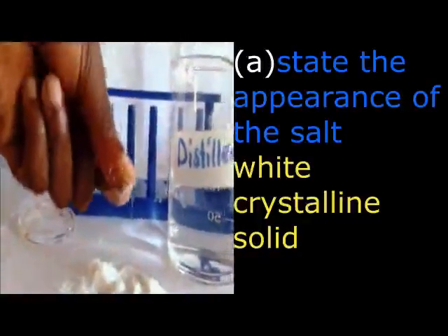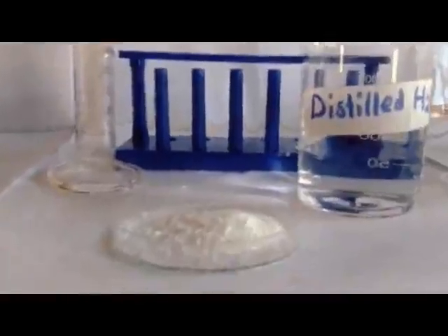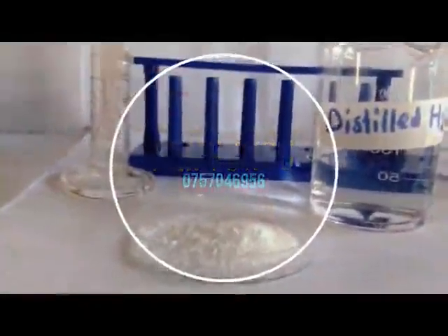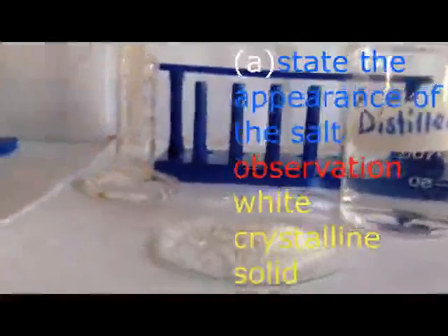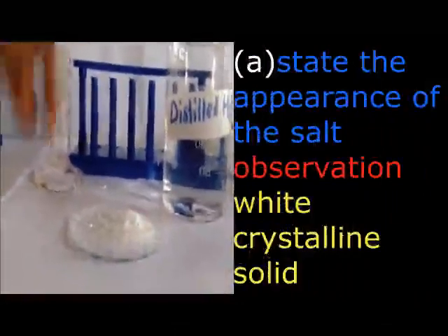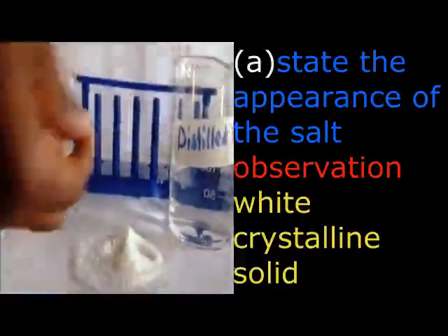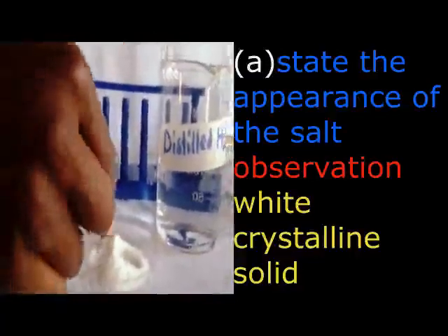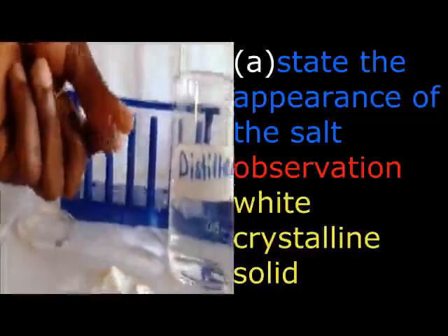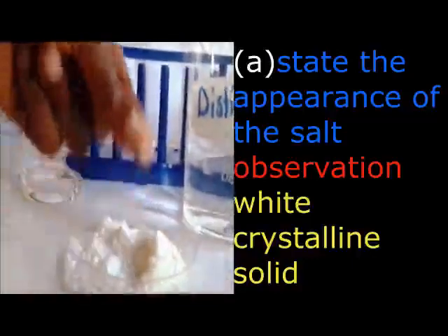Therefore, when we are recording our observation, as you are telling the teacher, we are going to begin with number one. At the beginning point, we are going to tell the teacher that it is a white crystalline solid. However, avoid putting a lot of grammatical words because the space which is given to you is not enough. So it is better to say white crystalline solid. Don't add "it is" or "a". That one is just a wastage of time. So the best recording would be white crystalline solid.